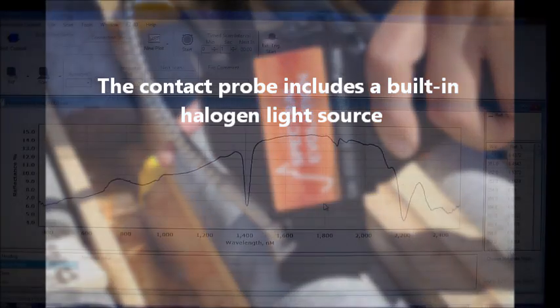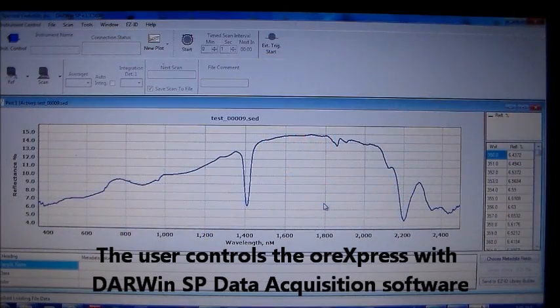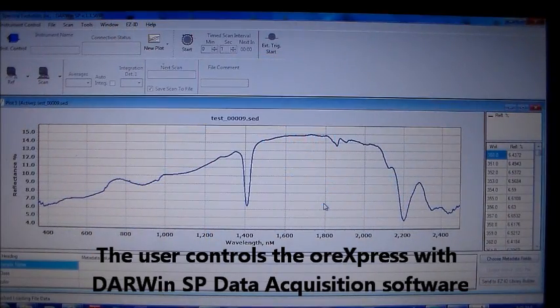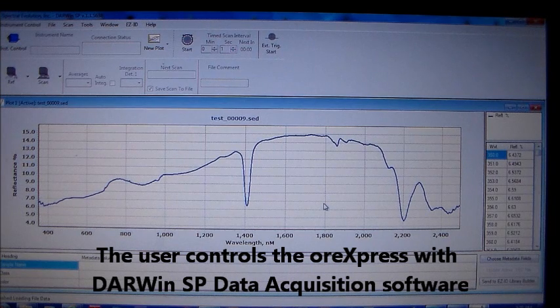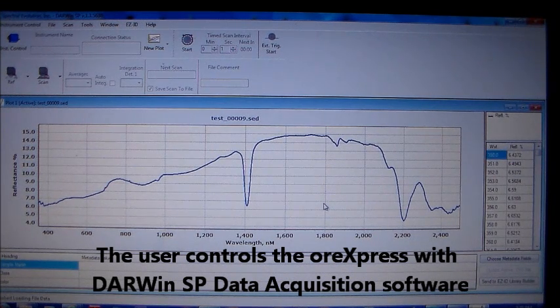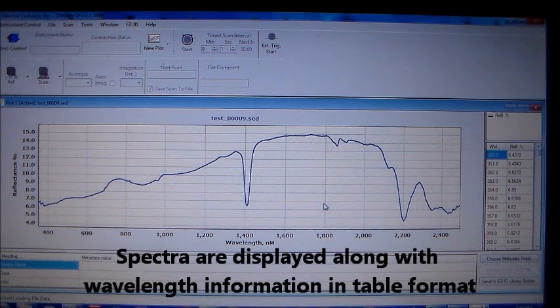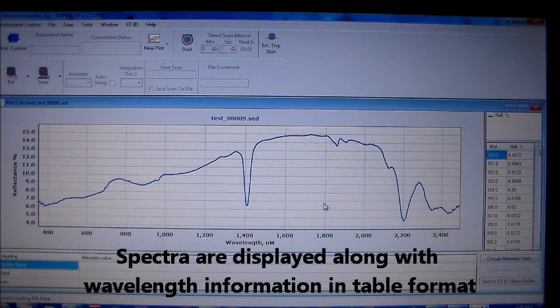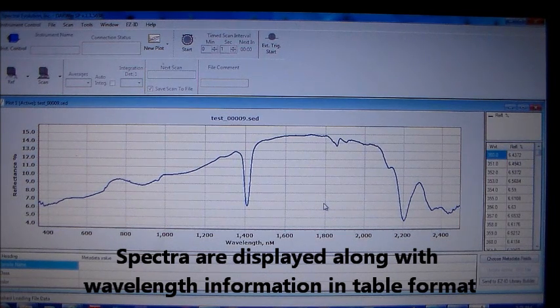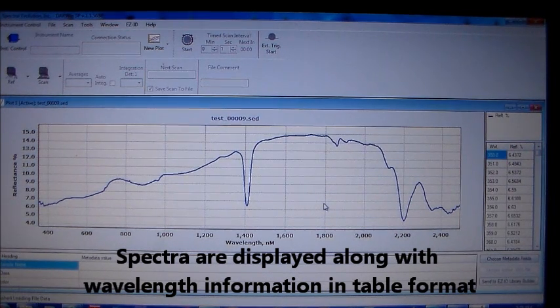Darwin SP data acquisition software is an easy-to-use interface for collecting spectra. Squeeze and release the probe trigger and spectra are collected and displayed in the Darwin window, along with wavelength features in table form.